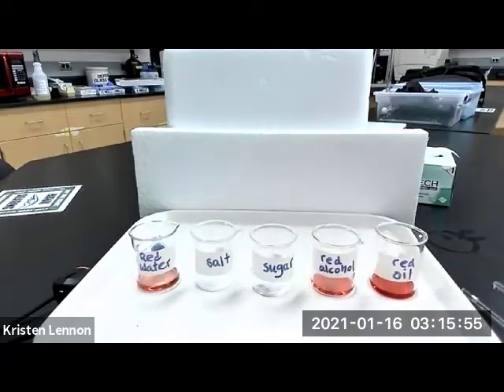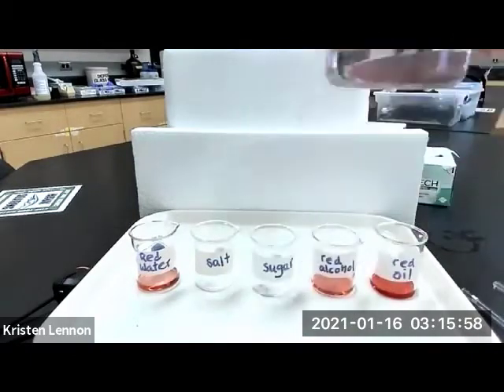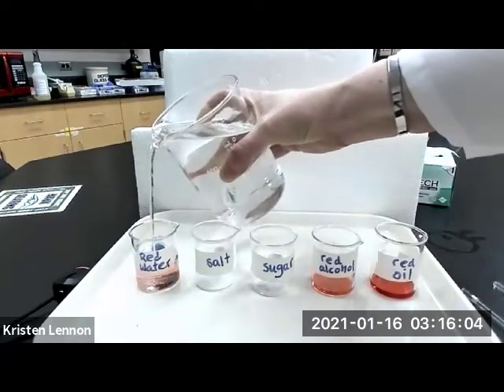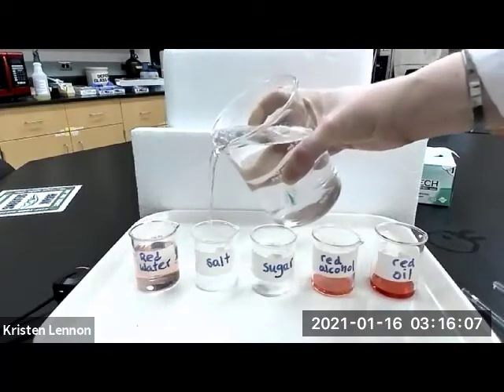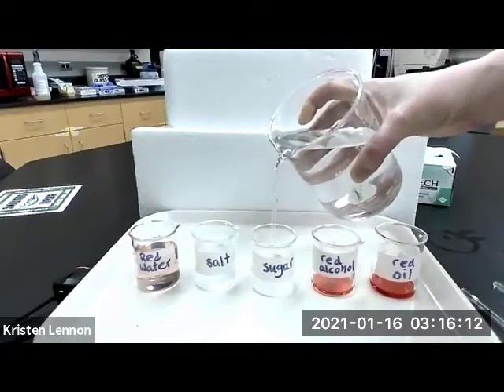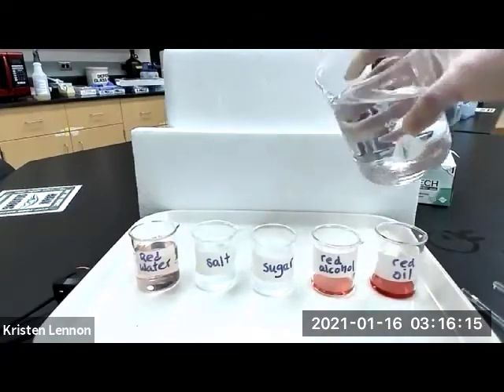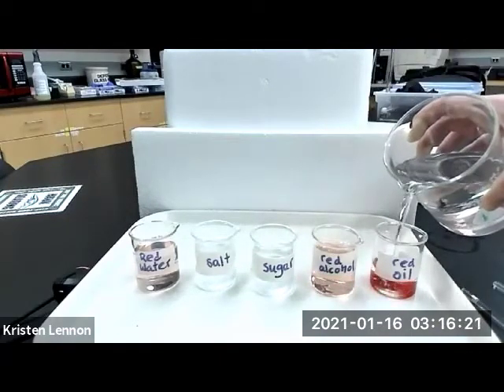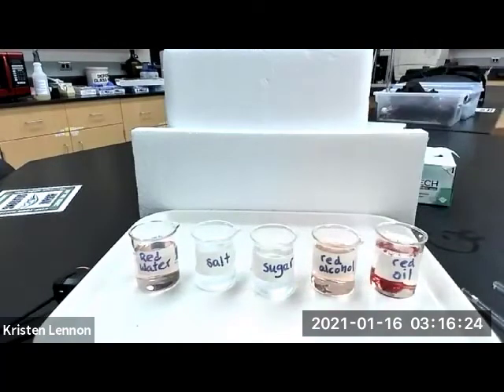So to these beakers, I'm going to add some water. Okay, so I've added water. Now, in general, if something is going to be dissolvable in water, it will dissolve on its own. It just may take a very long time.